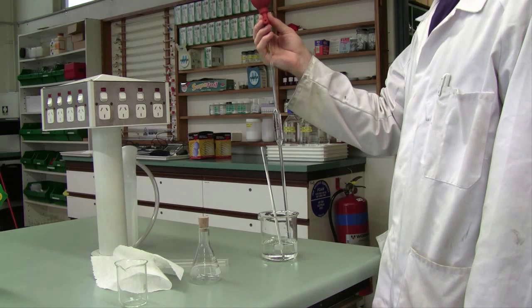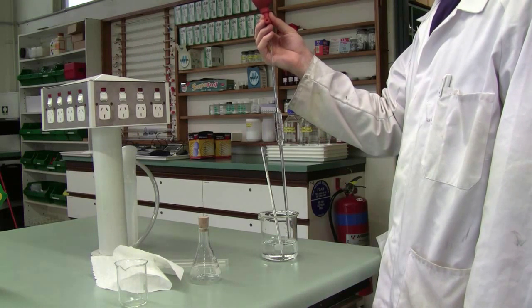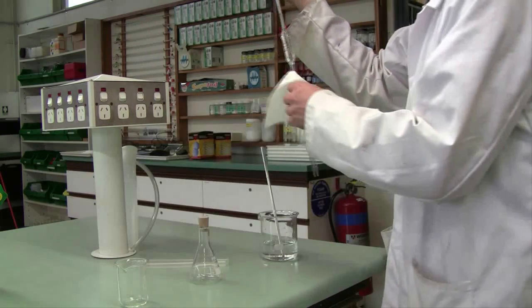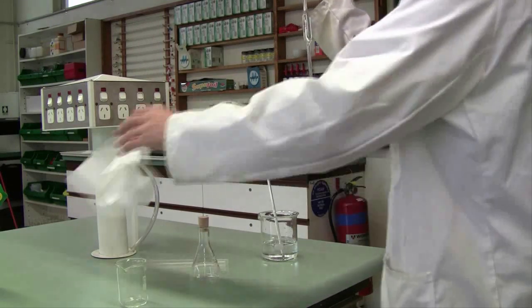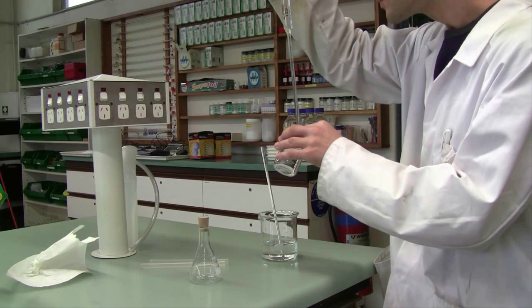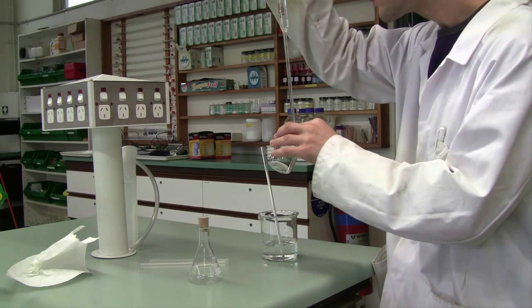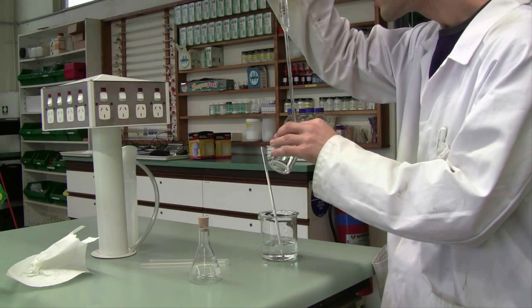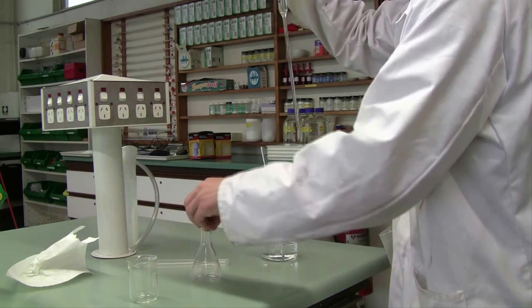The pipette is a specialist piece of equipment and has a very specific technique that you must use which I'm demonstrating here. For full instruction on how to use it I advise you to watch the pipette instructional video which is attached immediately below this one. Becoming accurate and precise for the pipette is one of your major goals for this unit.